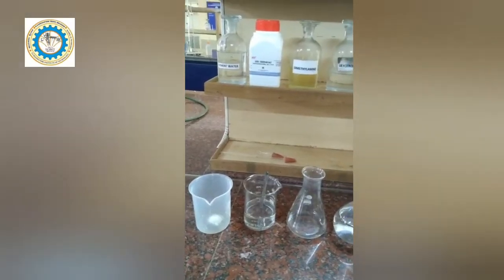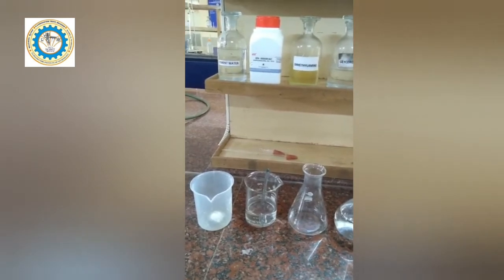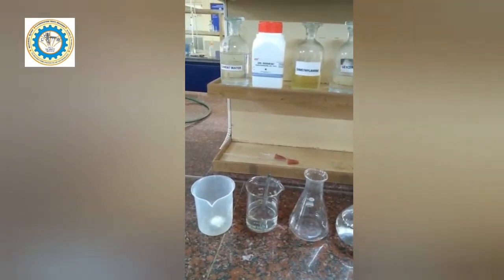Dear students, today we are going to perform the experiment of determination of CaO in cement water.